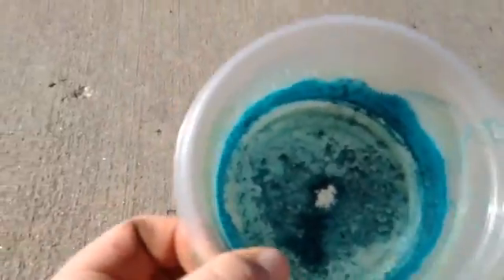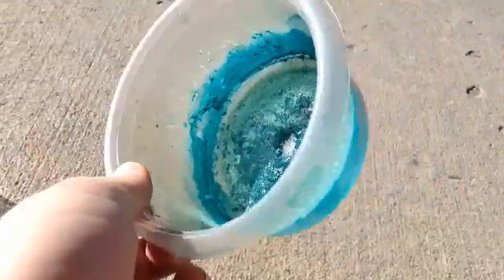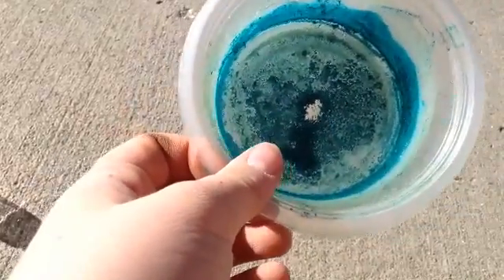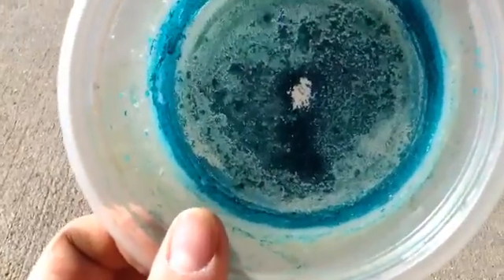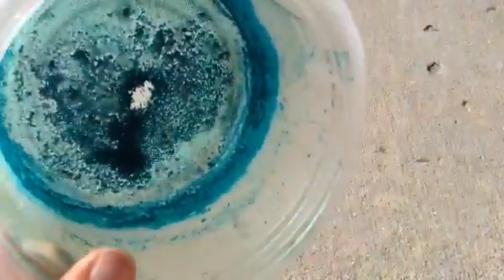Then you let it evaporate. I just let it evaporate naturally, but you can boil it. It took about a week — actually exactly a week for it to entirely evaporate. And you should be left with this blue powder.